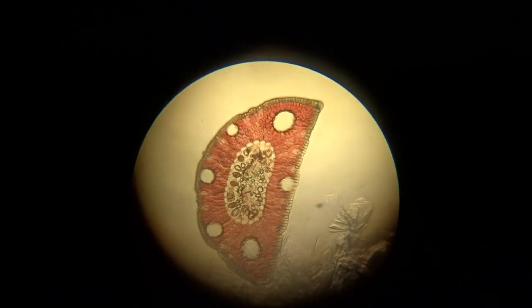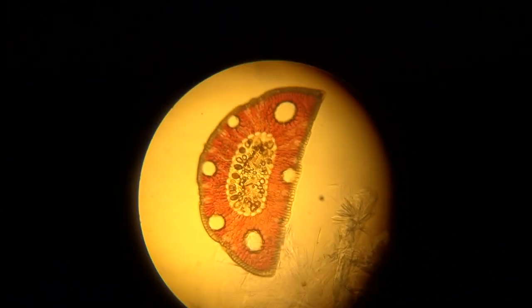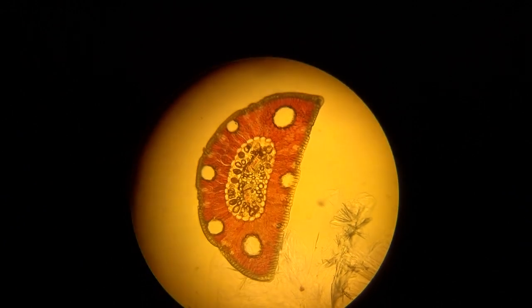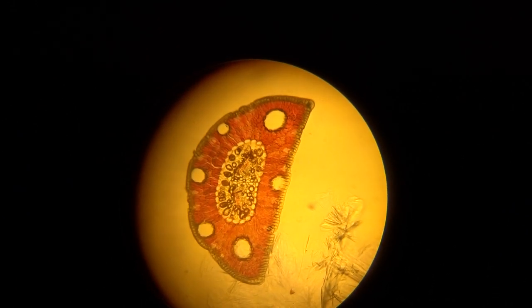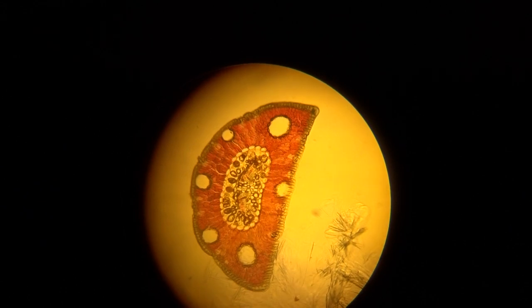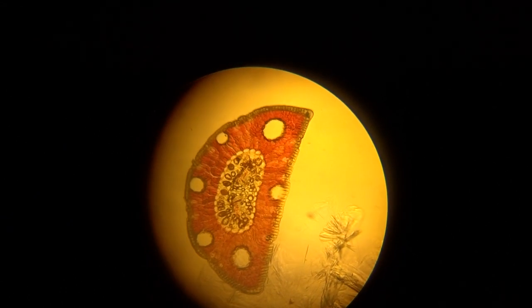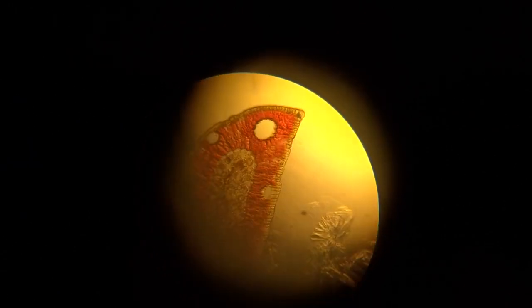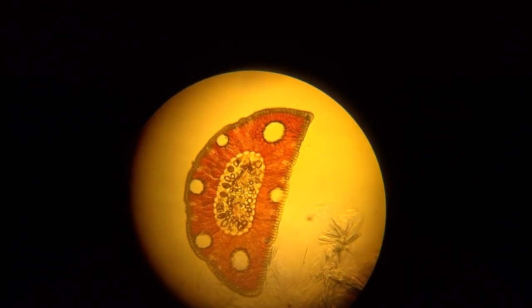Here is the pine needle. This is a cross-section of one single pine needle under 100 times low power magnification of the microscope. Let's switch over to high power and identify the cells.